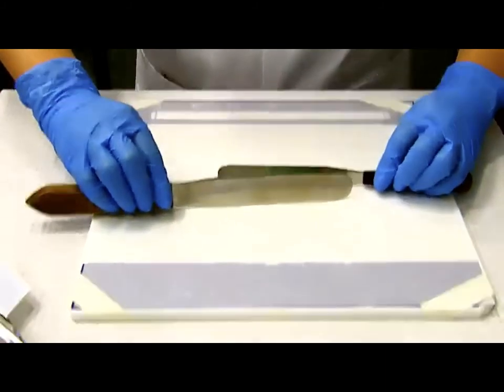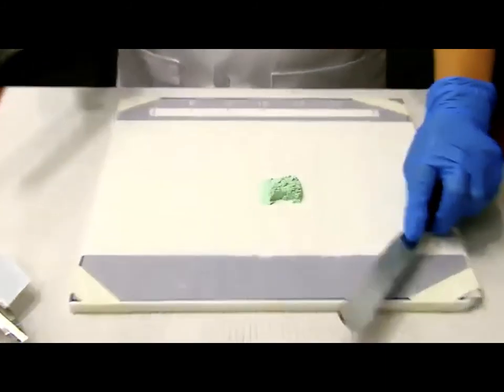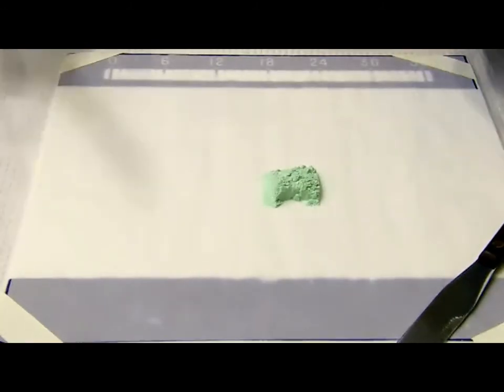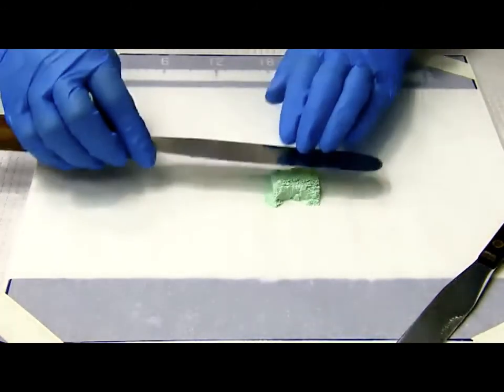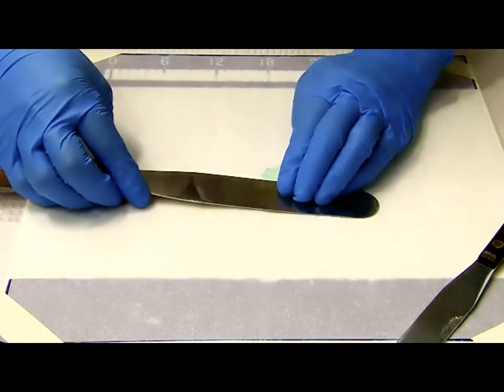So first of all, bring your powder together to make a relatively square looking powder. And then using the large spatula, you want to press down really hard. You are pressing down so hard that you are actually making a powder bed, which is very dense. That is the reason that we use lactose. You want it to be a very dense powder bed.